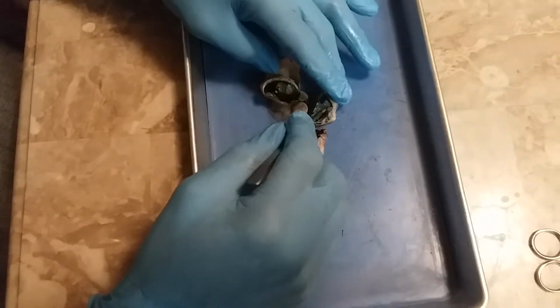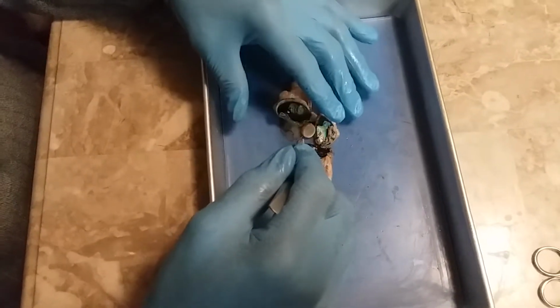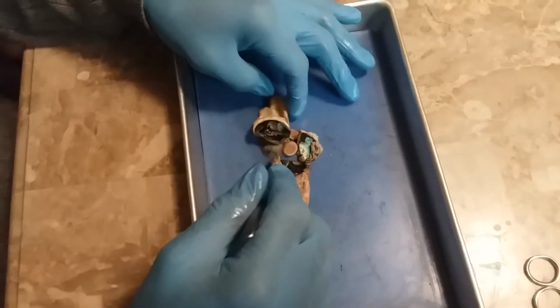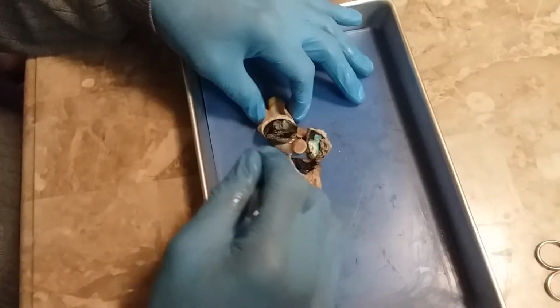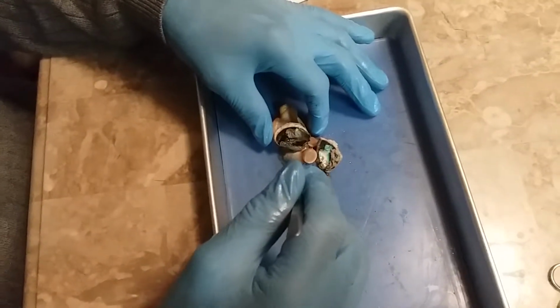We'll begin to identify the choroid, the thin dark sheet of tissue between the retina and the sclera, and we'll come down to the cornea, the transparent covering that allows light to enter the eye. On the preserved specimen, as we just demonstrated, the cornea is the cloudy area.